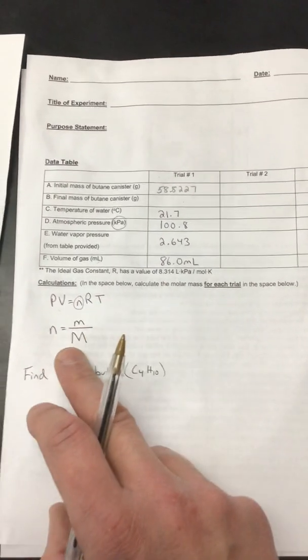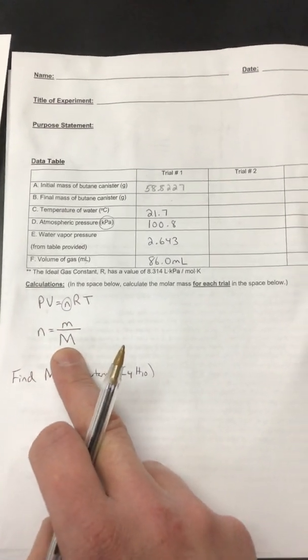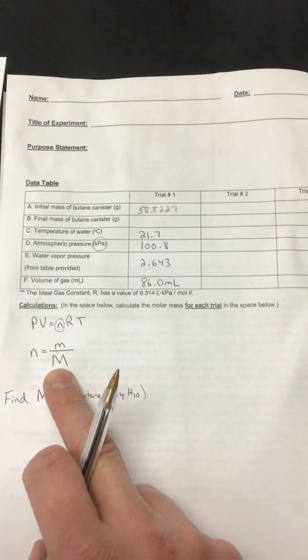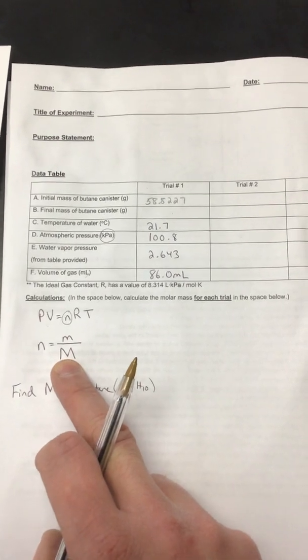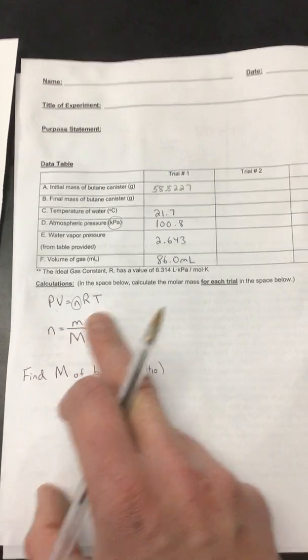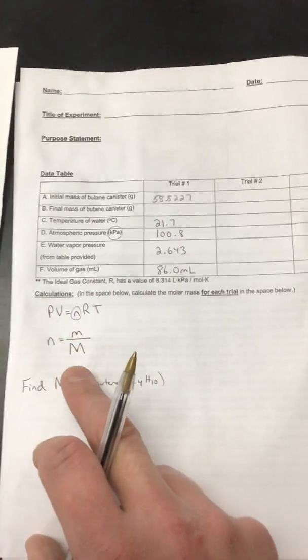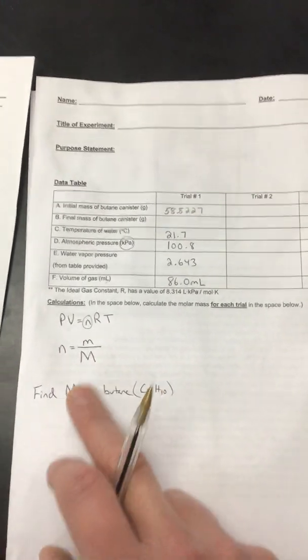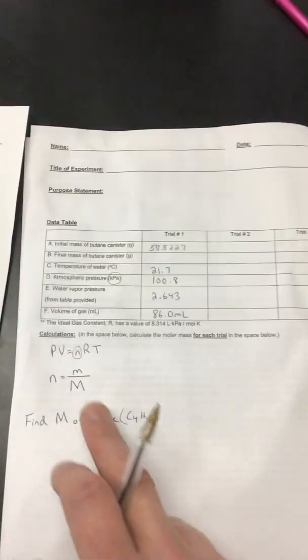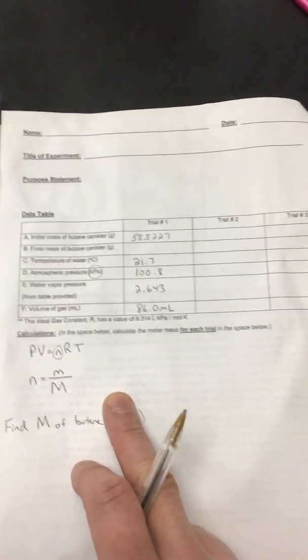And then the temperature. Make sure your units are in liters and kelvins so that they cancel and you'll get the moles. On your green sheet, the ideal gas law is present, but this equation is also on the green sheet in the same section, and big M is the molar mass. n is the moles of gas, m is the mass of the gas of the trial. Rearranging this equation, you should then be able to solve for big M, which is the molar mass of butane. And this is how you will experimentally determine the molar mass of butane for each of the trials.